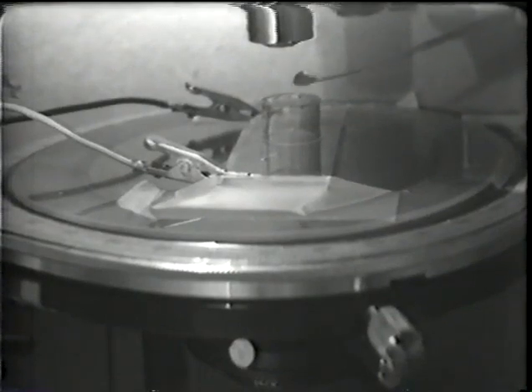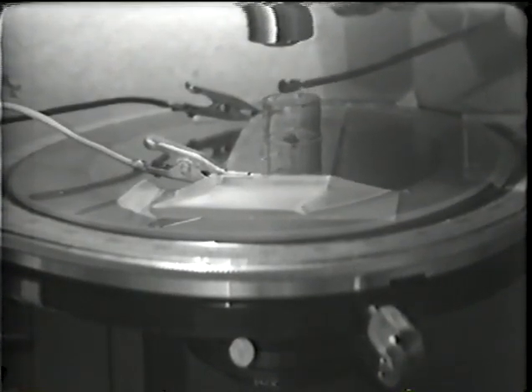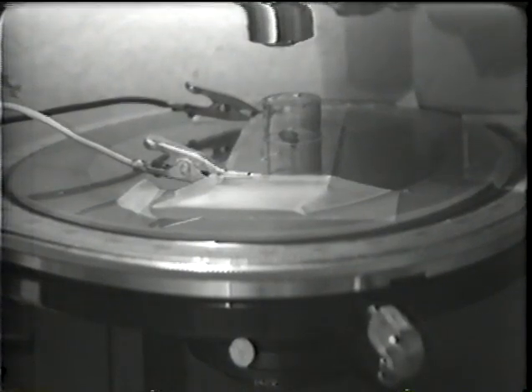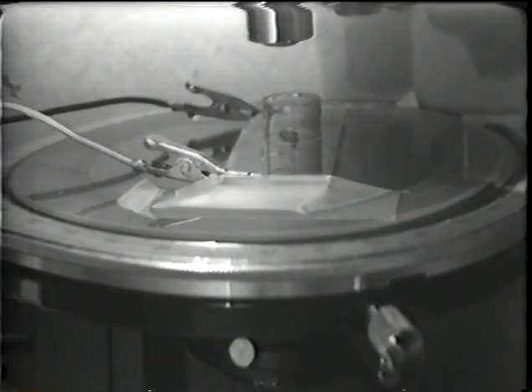It's a 1 centimeter length of ordinary glass tubing, and here a milligram or less of picramic acid in the bottom of the cell. And if we then focus on a cover slip, which will be placed on the top of this cell to enclose the whole system, we can watch the sublimation of picramic acid.